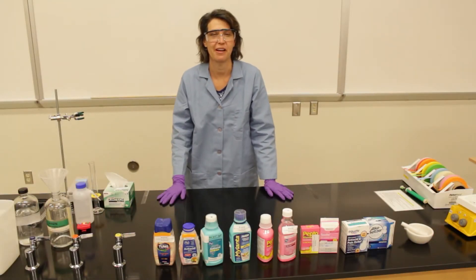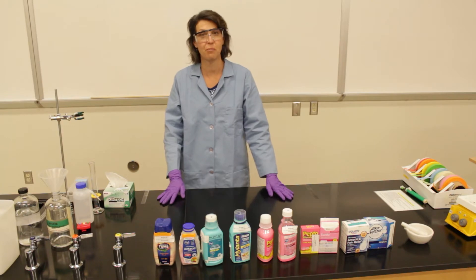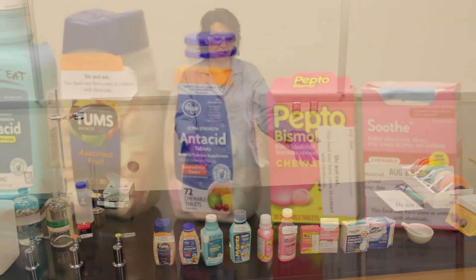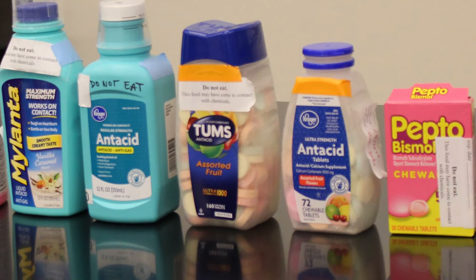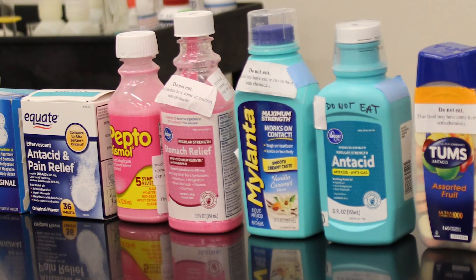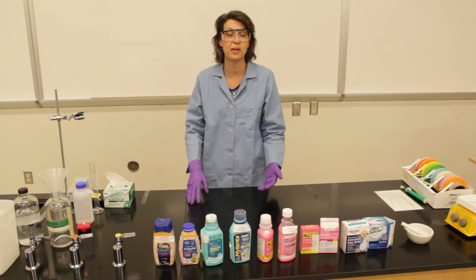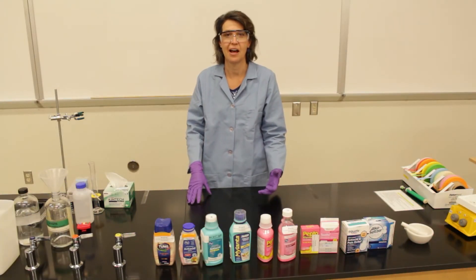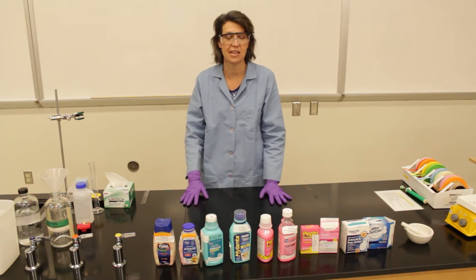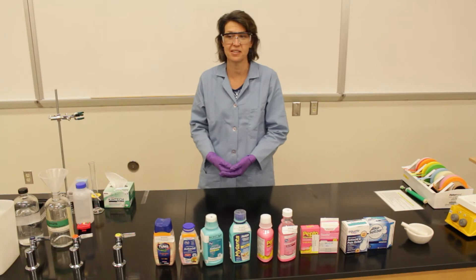I'm Jennifer Ketcher, I teach biology here at Pima Community College, and today we're going to do a lab called Comparing Antacids. You can see we have a variety of antacids here, and this lab gives us a chance to look at how we can affect pH in living systems.